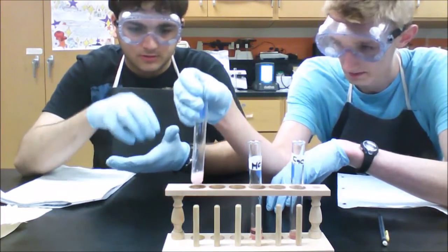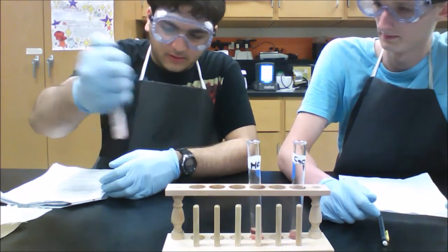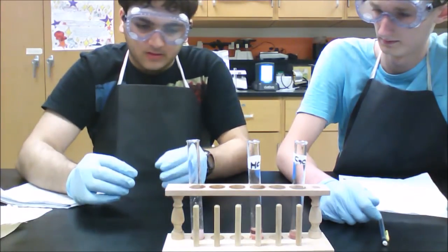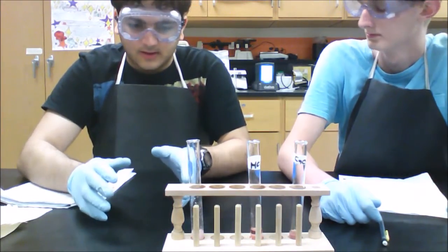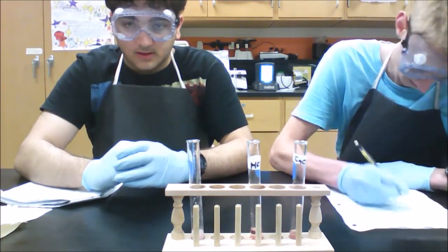Yeah, the particles will be there because unless you're continuously swirling it, the particles are not there. But the moment it settles, particles appear. That's how it happens with the silver nitrate mixed with the cobalt chloride hexahydrate.